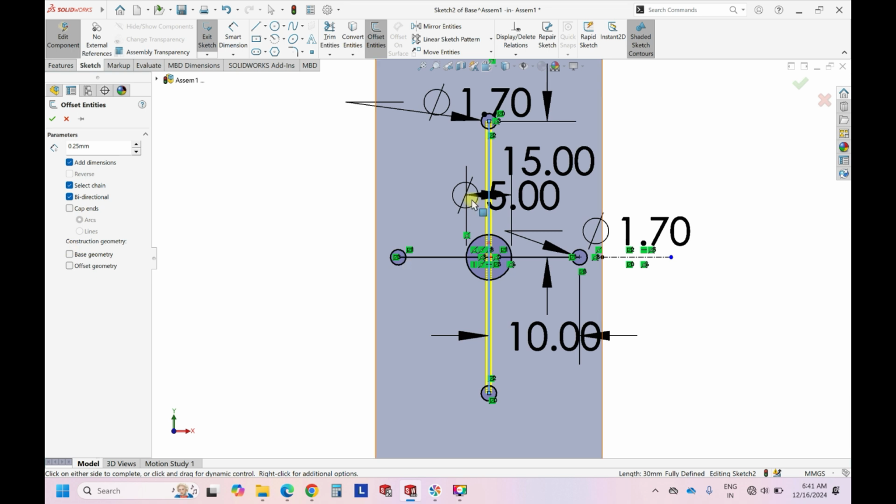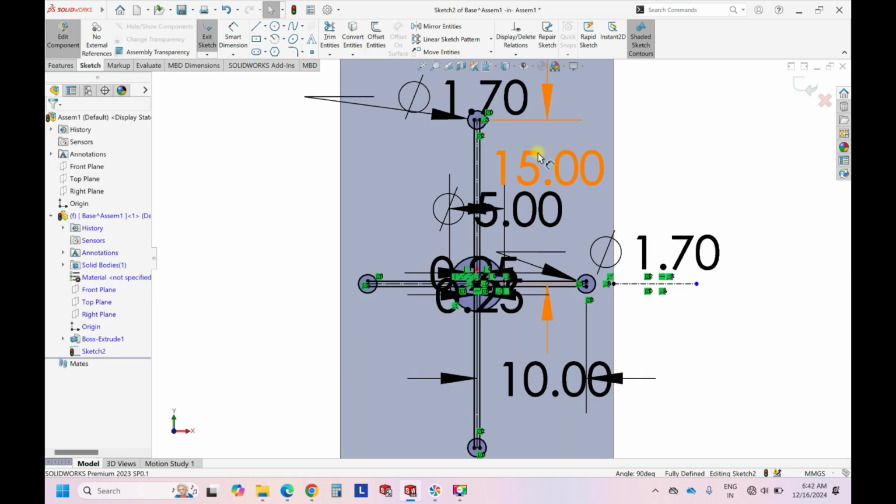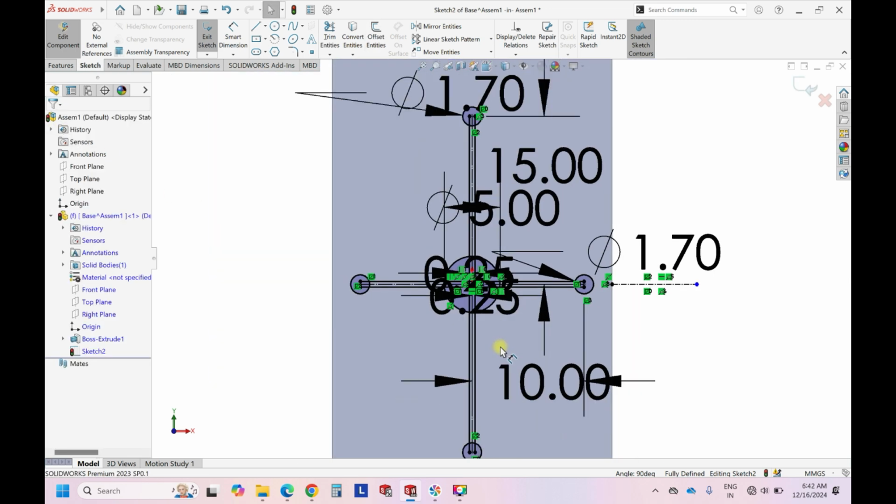And then the line that we have drawn is not needed for us, so we can create a construction geometry of the base geometry. It means the previously drawn line, and choosing this line will also give this. Okay, click OK. So once if you see, this has been done.